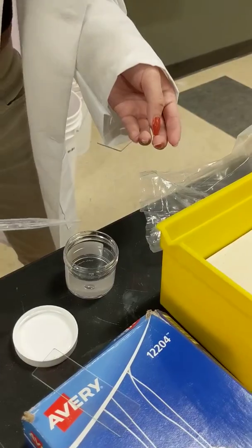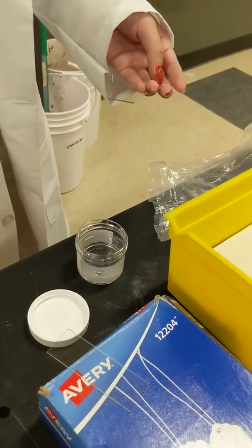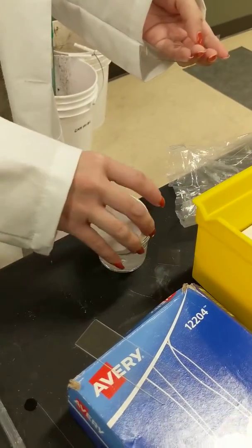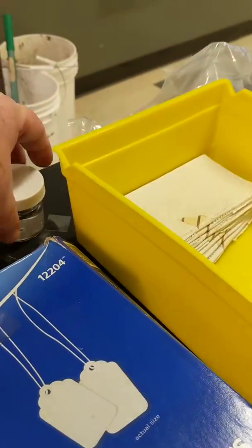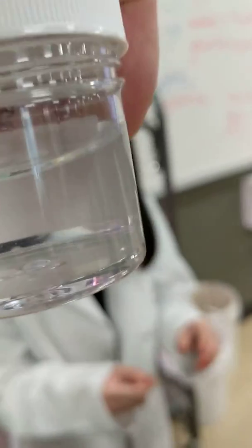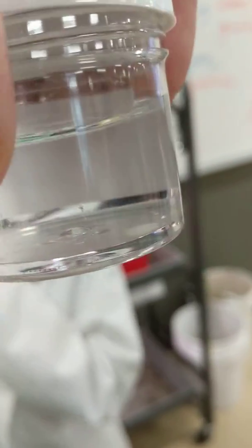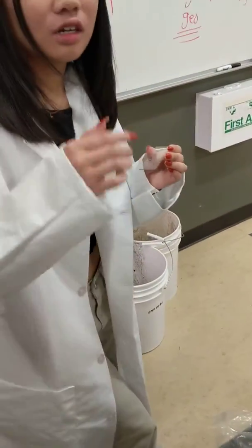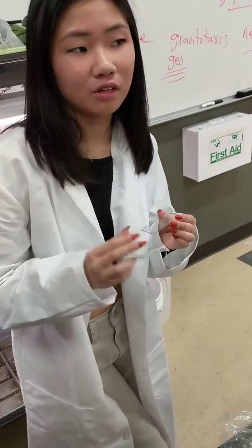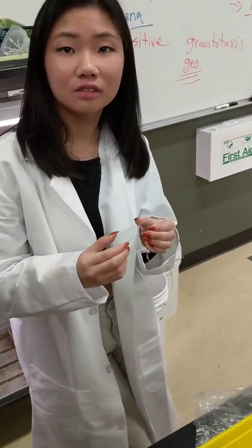So what are you doing? What are you looking at? I'm trying to get amoeba right now to analyze under a microscope. Are you able to see the amoeba in the box here? The amoeba are going to be down on the bottom and you can kind of see them in there. And then what are you going to do with them when you get them in the microscope? I'm going to analyze them under light and no light.